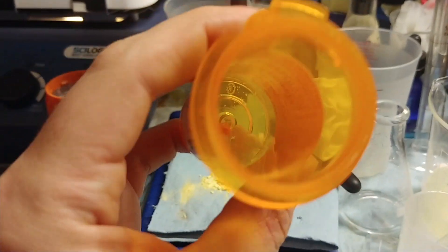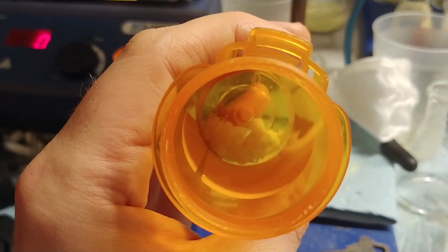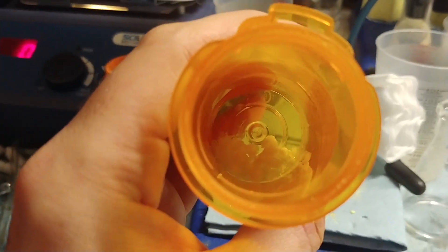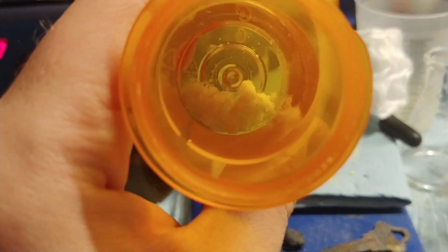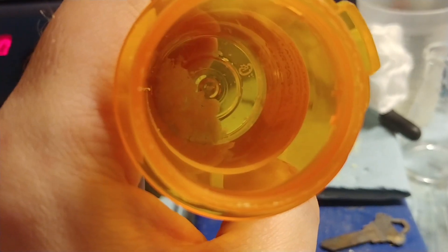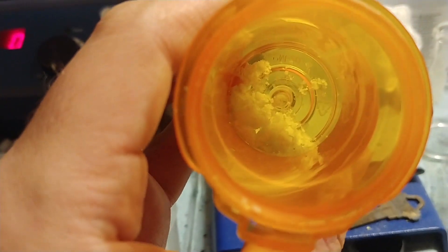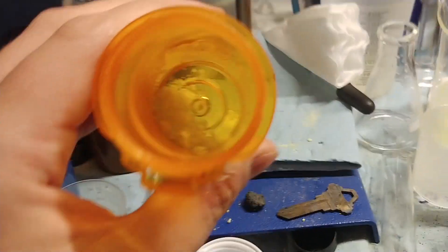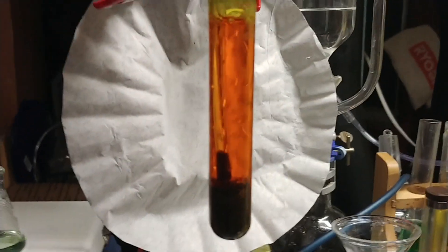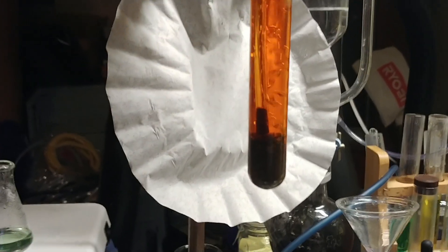This is the amount of sodium thiosulfate I've created previously. I would have much more yield if it hadn't been for some accidents, plus times when the solution dropped to about neutral — it started to produce hydrogen sulfide and elemental sulfur in solution, which obviously decreases yield. But at least you can reuse the sulfur. Anyhow, I've been bound and determined to make this method of creating sodium thiosulfate work, though it's definitely not a cheap route.